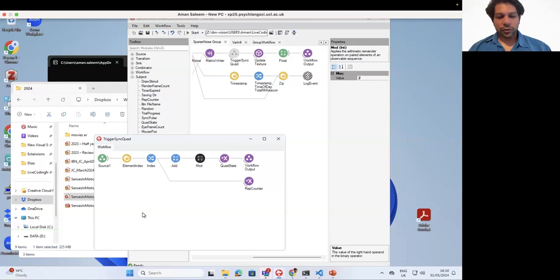So for example, if you were going to present a movie rather than this sparse noise stimulus, you can get the element index of the frame that is being presented and do the same strategy, where you flip the quad state on every frame of the movie that is being presented, going from black to white and so on in this sequence. I know Phil Parker was asking me about the strategy for flipping the photodiode in the case of a movie, or a pre-designed stimulus, and that would be the strategy that I would use.